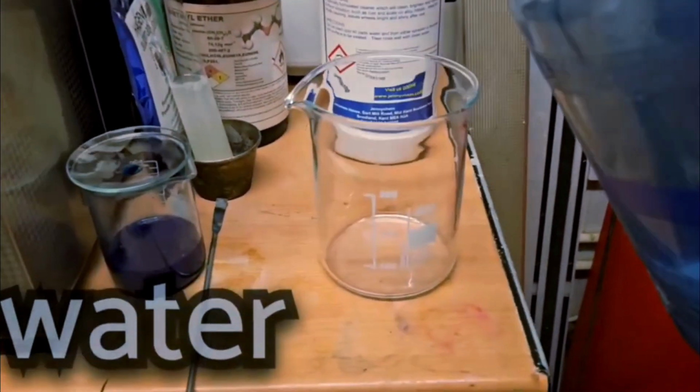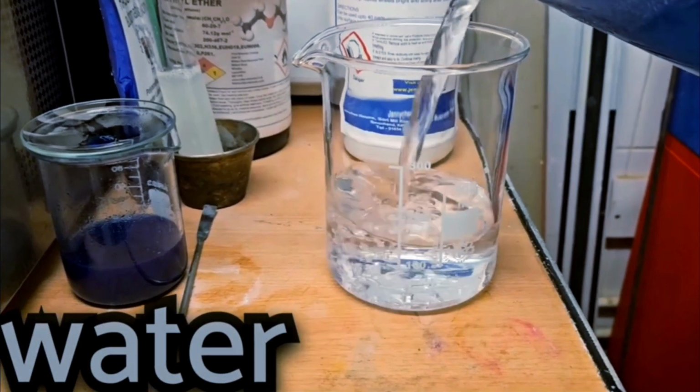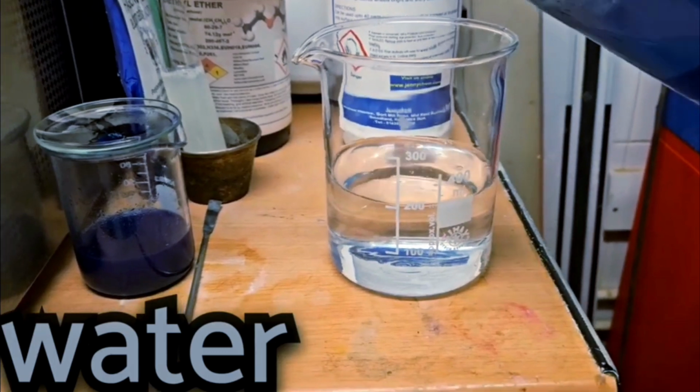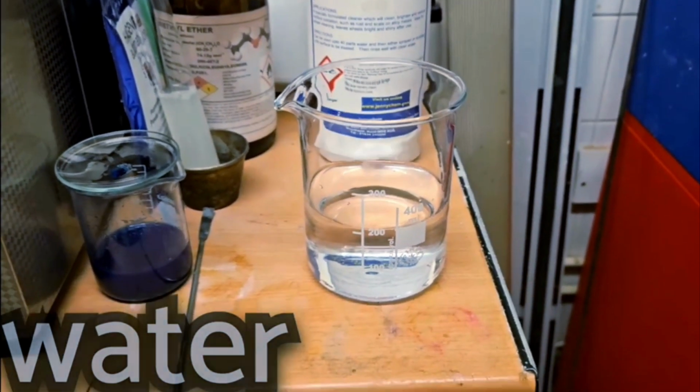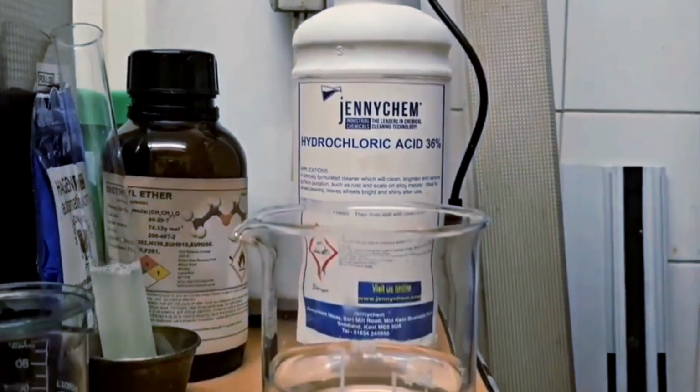We can precipitate rayon cotton with an acidic medium. Here I add a small amount of hydrochloric acid to water just to make an acidic solution.